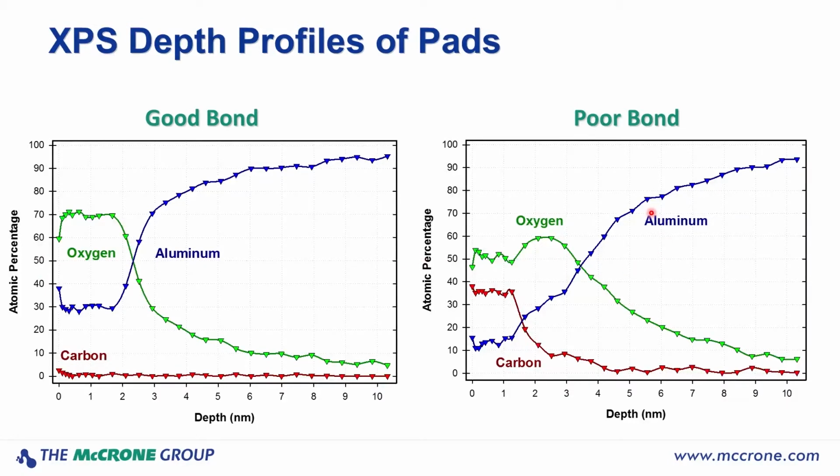In contrast, if you look at the poor pad, as we suspected, we see a layer rich in carbon, and it's around 1 to 1.5 nanometers in thickness. We can see there's also oxygen that we're picking up, both associated with that carbonaceous layer, because we know there's an ester or acid functional group included, and maybe some of the oxide layer associated with the aluminum surface. Once we sputter through the carbon layer, then we see the oxide layer that we would expect from an aluminum metal surface, and then eventually we sputter through that and the aluminum metal is exposed, oxygen and carbon go down. So from this analysis, we can say that the thickness of this carbonaceous film on the surface of these wire bond pads is less than 2 nanometers thick.